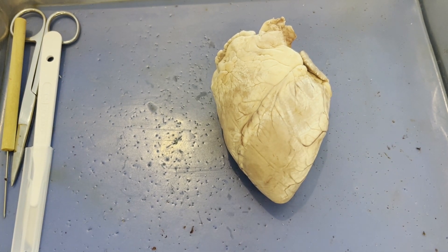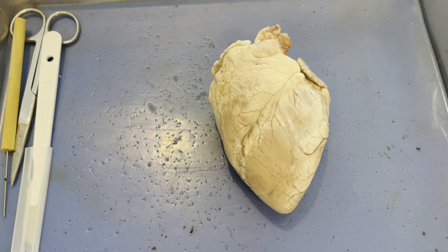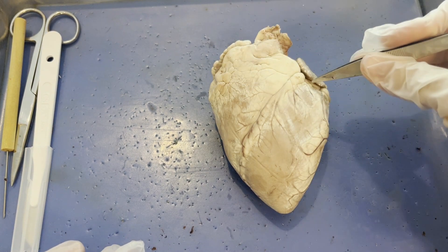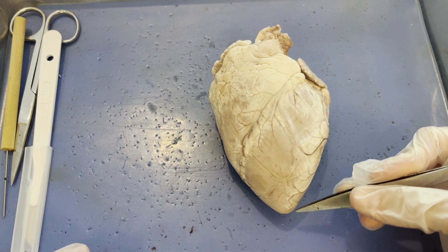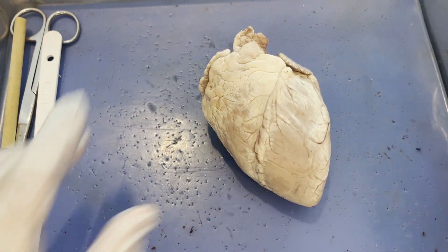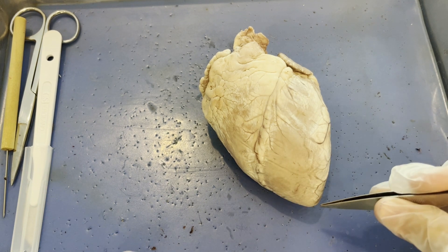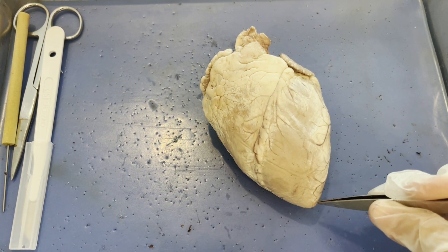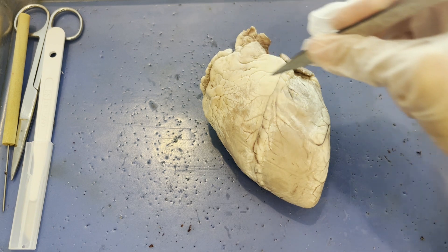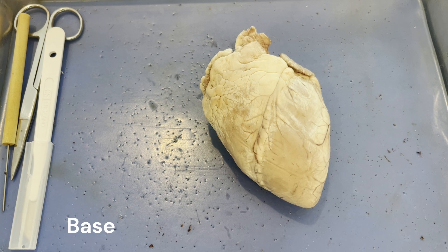We need to orient ourselves around this heart directionally. Picture the heart sitting in the tray as if a patient were lying in front of you during open heart surgery. There is a superior portion of the heart closest to the patient's head, and an inferior portion closer to the abdominal cavity. The heart is tucked inside the thoracic cavity, tilted slightly left, which is why the left lung tends to be smaller than the right. The inferior most pointed portion is called the apex, and the superior wider portion is known as the base.